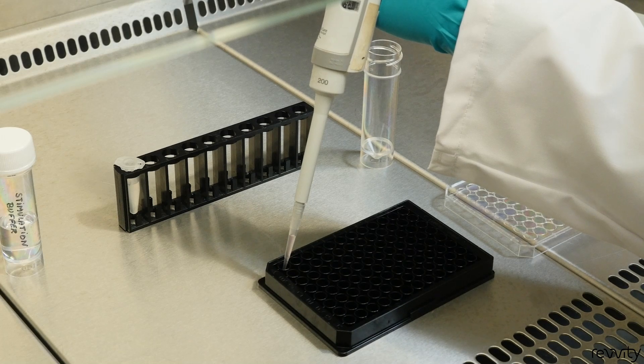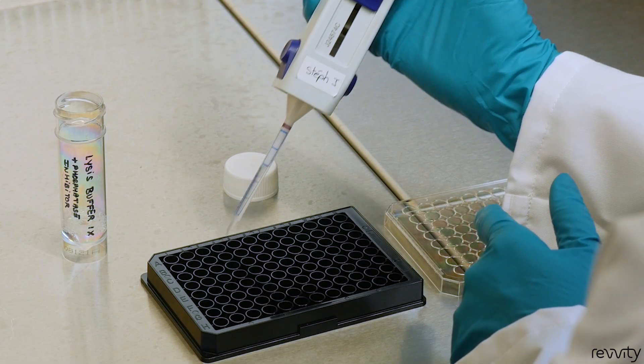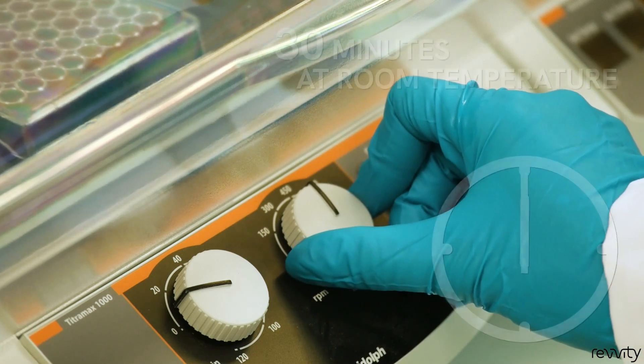Remove cell supernatant carefully. Add supplemented lysis buffer and incubate 30 minutes at room temperature under shaking.